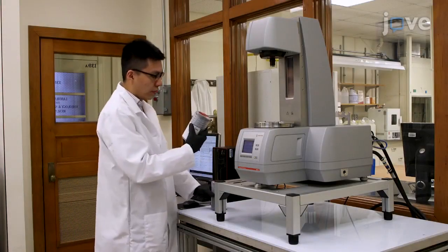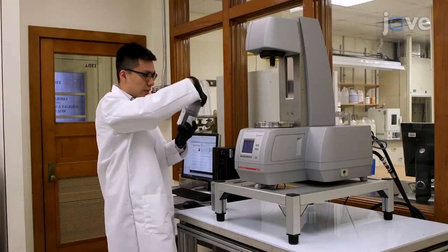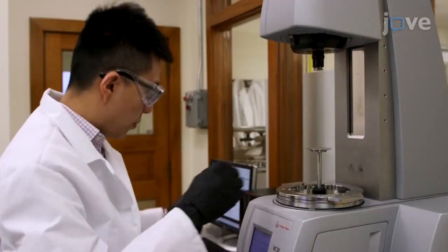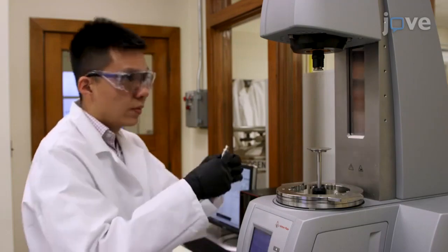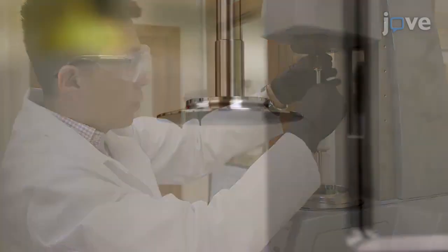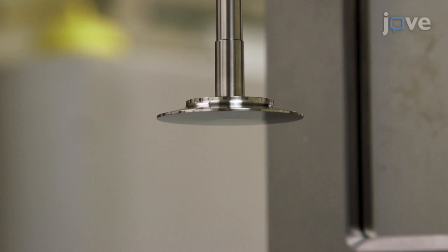Work with a rheometer that can perform strain-controlled measurements. First, attach the upper and lower drive geometries. For the lower fixture, use a 50mm plate. Use a 2 degree cone for the upper fixture.